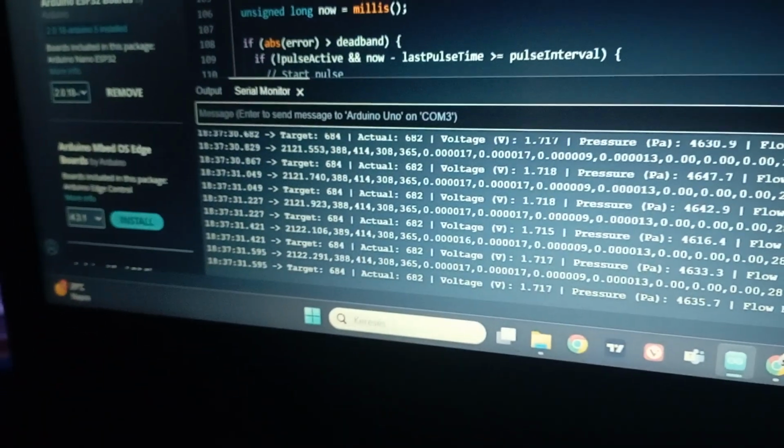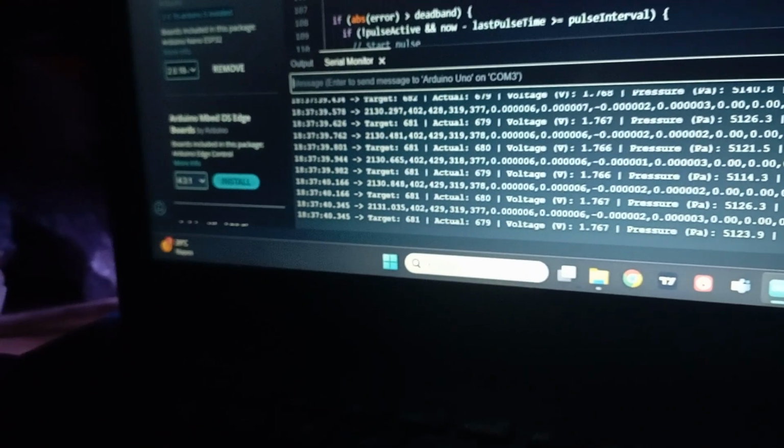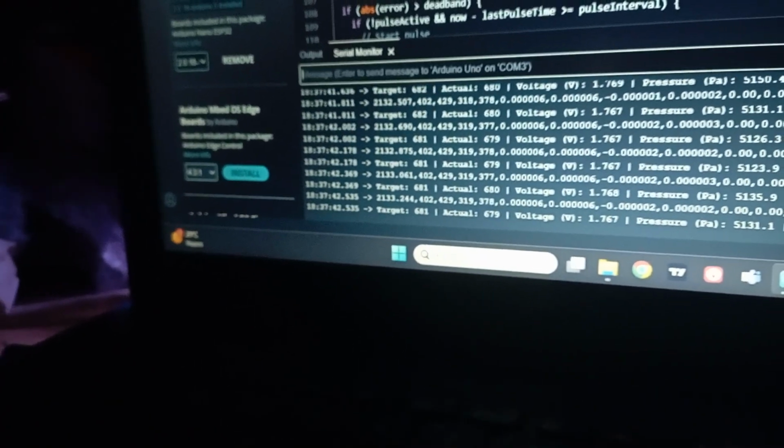I can't even see. Maybe we are burning, I have no clue, but I don't think we are, because this should be more or less 380. I mean, it is 389, but jumping around from 380 to 402, which is interesting in itself. Very interesting. Maybe we are burning, I have no clue, but it wasn't hot to the touch, so I assume that we are not. Just going to check it manually. Gonna open the hood up.